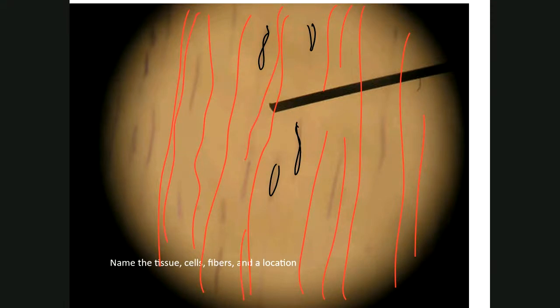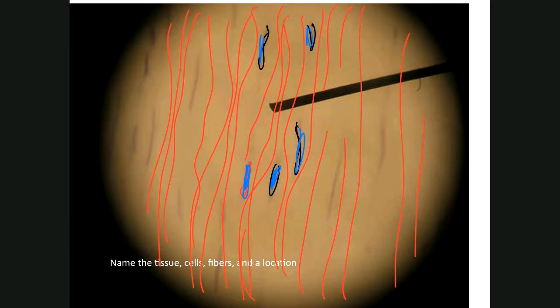There is no surface, so that tells you that's not epithelial tissue. No nervous tissue, because we don't see the big neurons, so that leaves those two out. We're left now with connective tissue and muscle tissue. All right. The cells, which are these little purple structures right here, are kind of hidden by the faint red fibers. So when you have lots of fibers hiding cells, now we're talking about connective tissue.